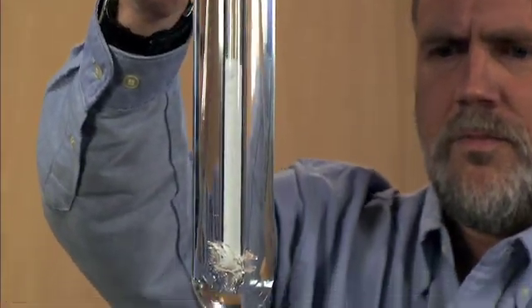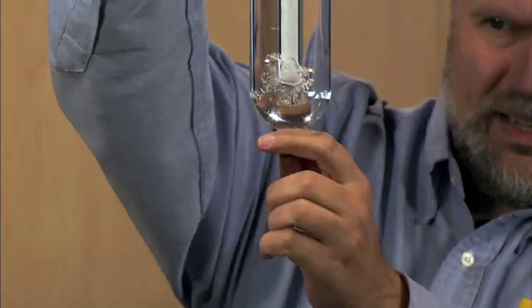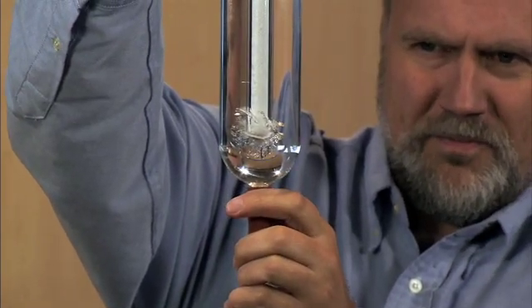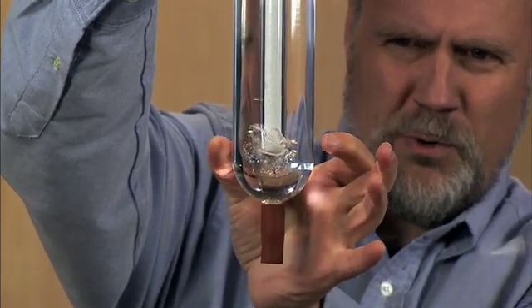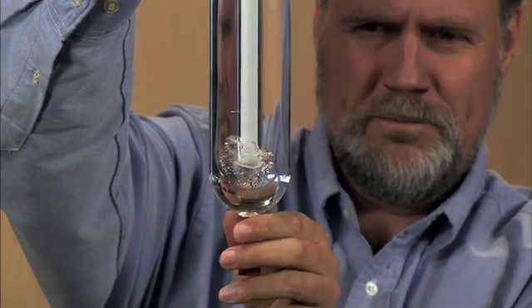The ice mantle that we're seeing in there looks larger than it is. As I sit here and look at it, it looks to me to be just a couple of millimeters away from the edges of the cell down here.